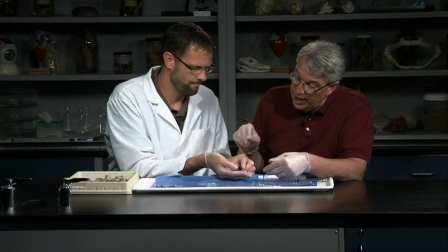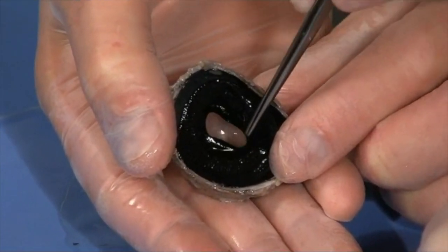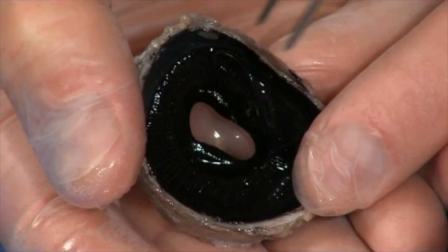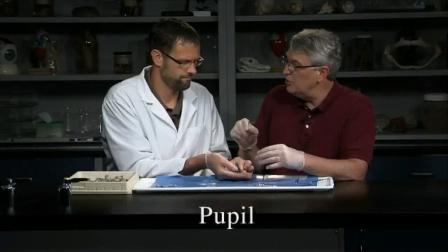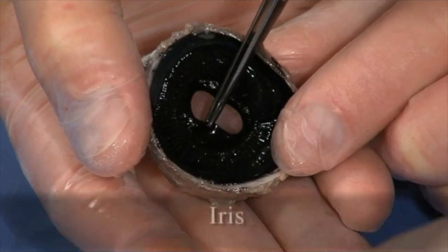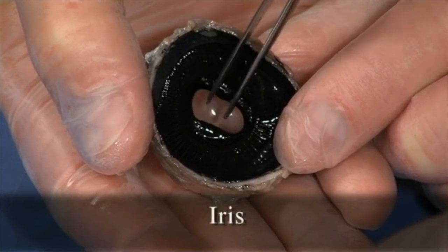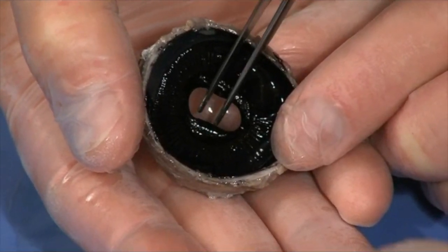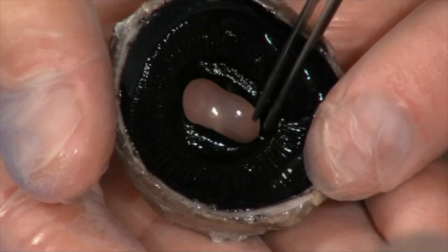Okay. And again, from the back, we can see the striations of the ciliary body, and then right around this opening, this space, is the pupil. This pupil is the space where light enters and comes through the lens. And of course, right around the pupil is the iris. So this tissue here is the iris of the cow eye. It's not as colored as it is in people. And that iris has muscles that control the diameter of the opening of the pupil.